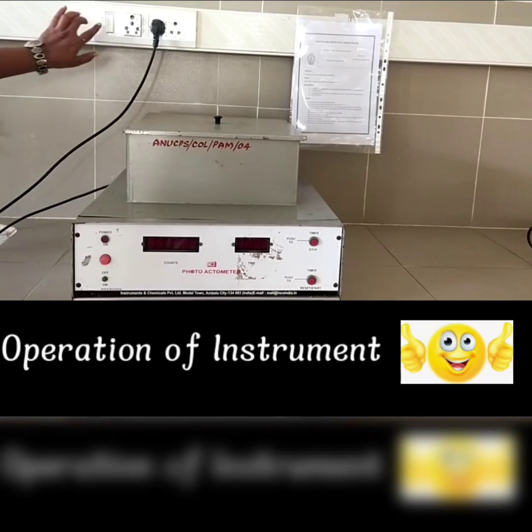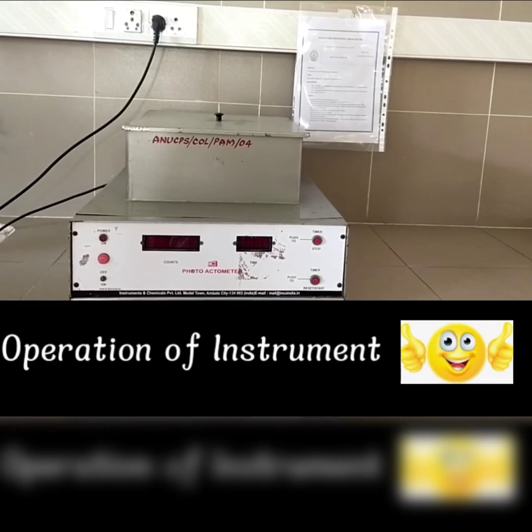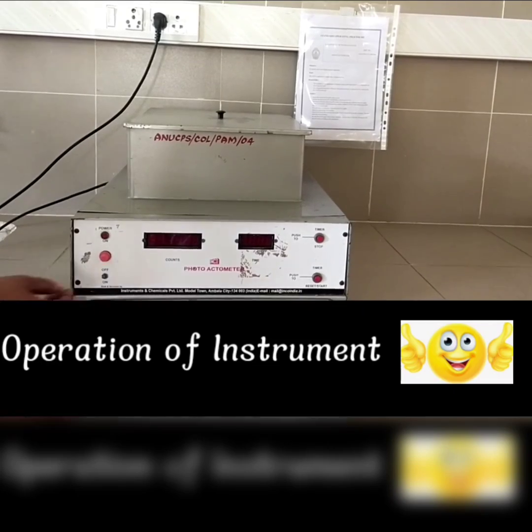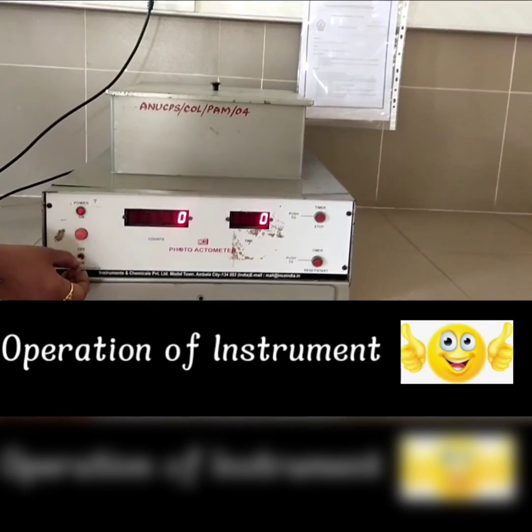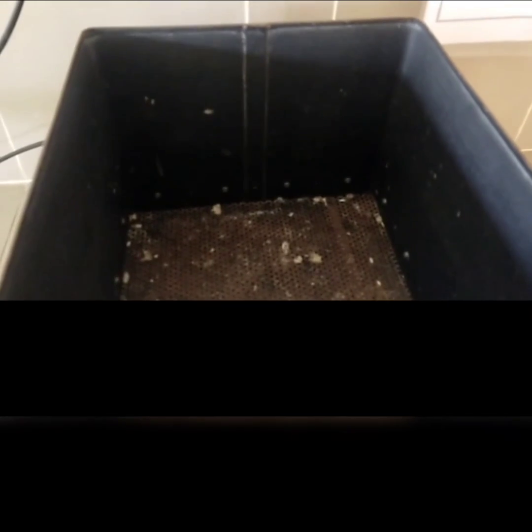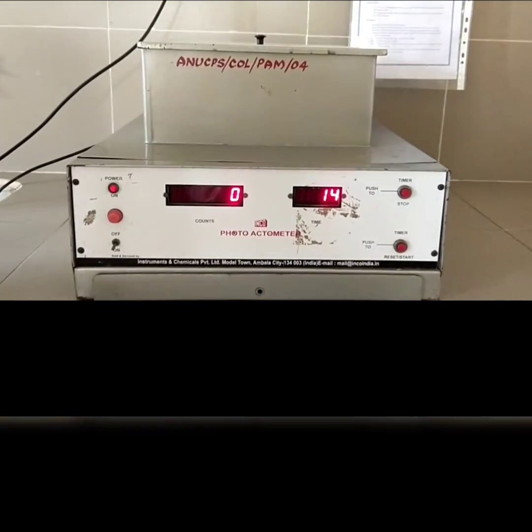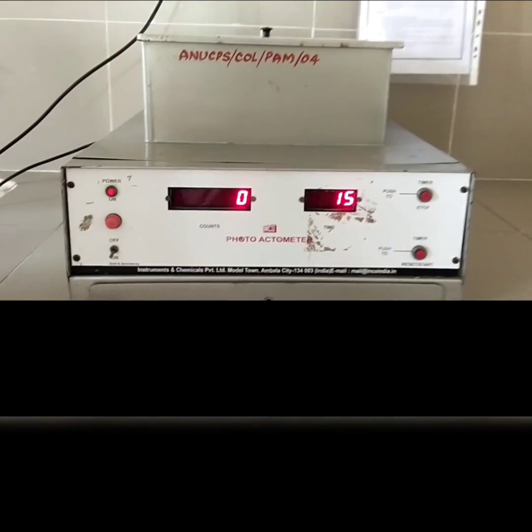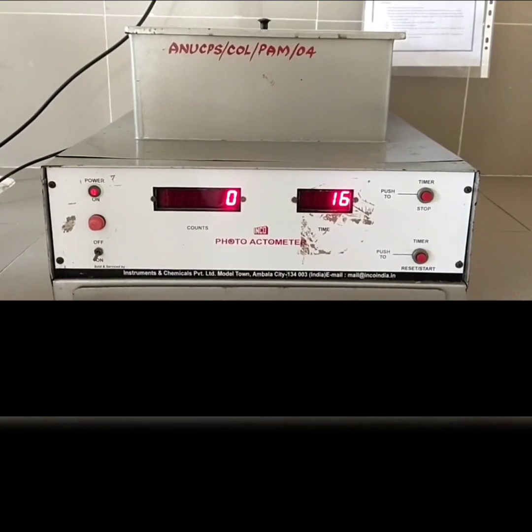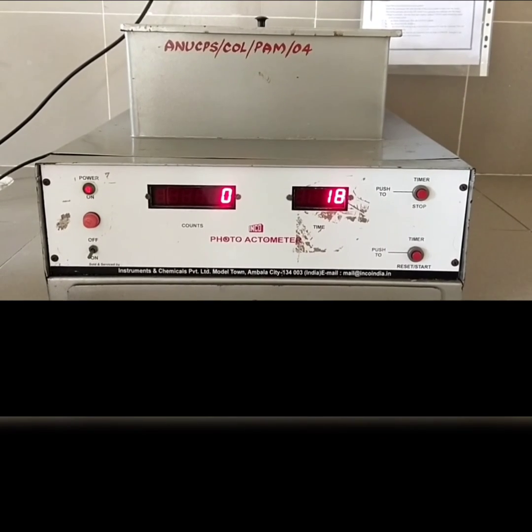How to operate: Check the connections of electricity wires and attachments properly. Place the animal inside the chamber. Set the reading to 0. Record the locomotor score of animals before and after drug treatment.